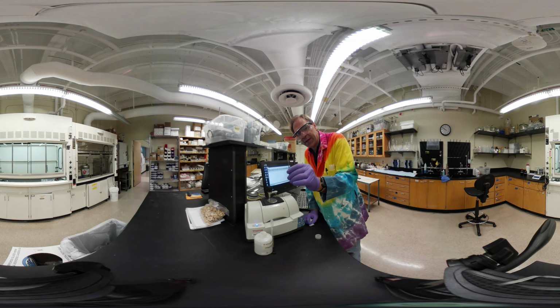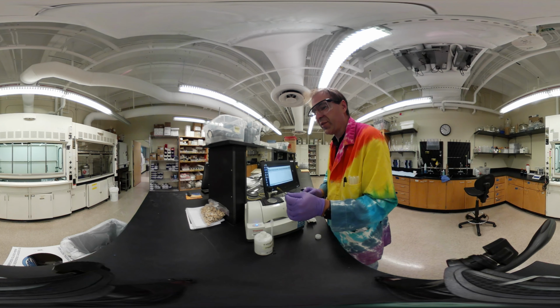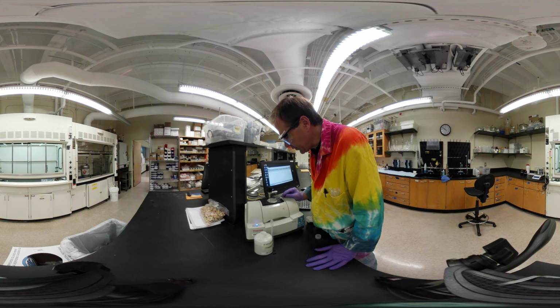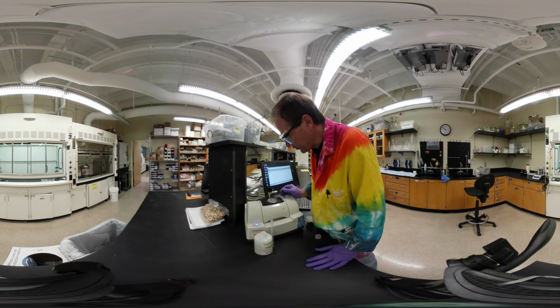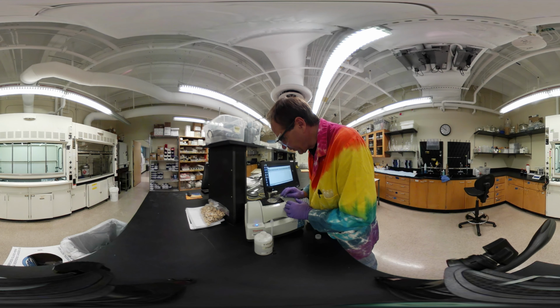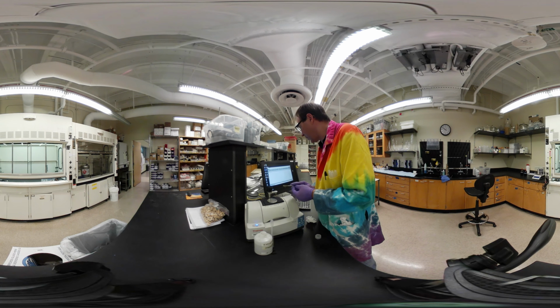All right, so I just have a little tiny bit of our product here. It's on the end of my spatula tip. This is a yellow compound. So we're going to goo up the instrument, it looks like. It's mostly dry. This sample is a little bit wet. I'm having trouble getting it to be completely dry. Also, I'm having trouble getting it off.